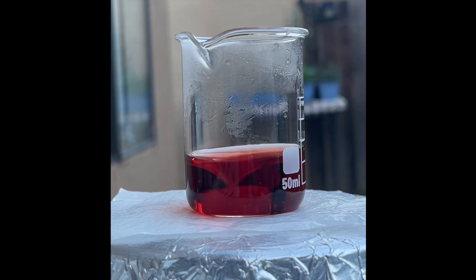Let's examine the color transition in slow motion. We witnessed a wide range of colors during this transition. For the rest of the video, I'll play it at twice the normal speed.